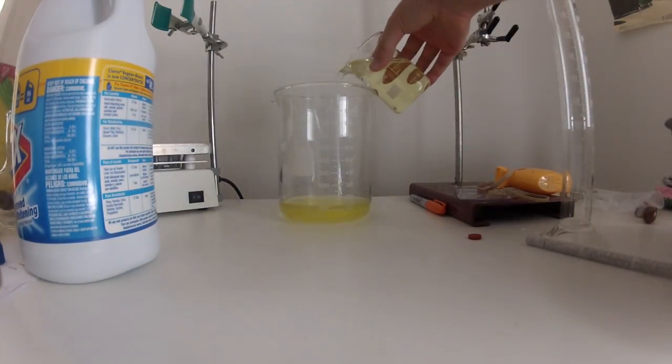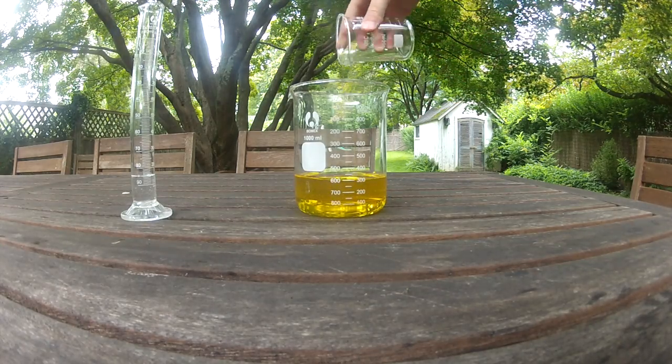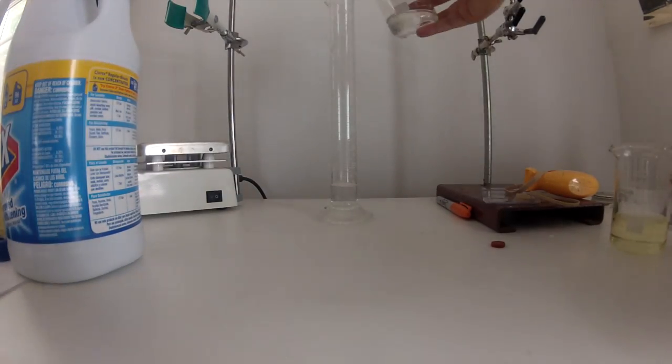Then add 205 milliliters of bleach. Now prepare a solution of acetone.